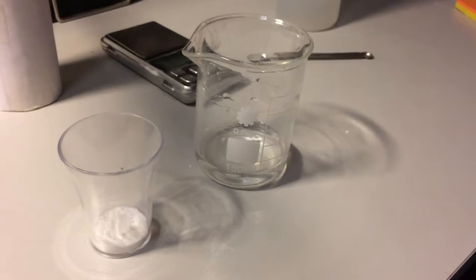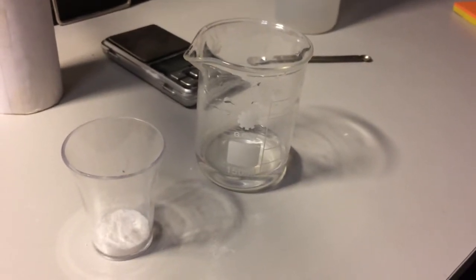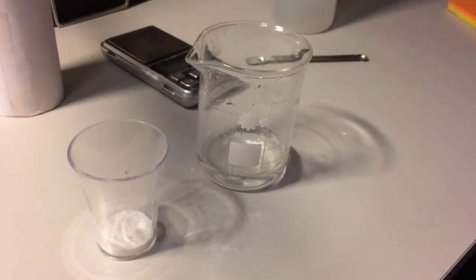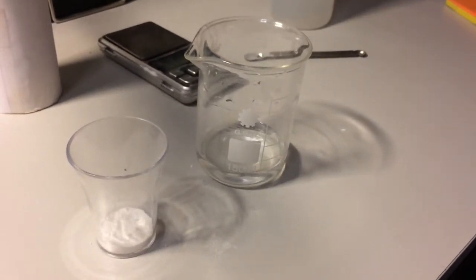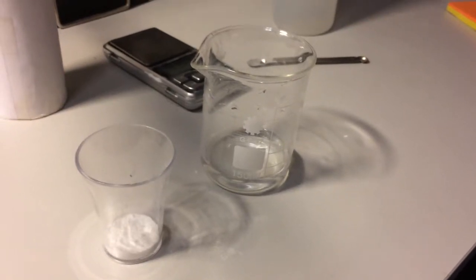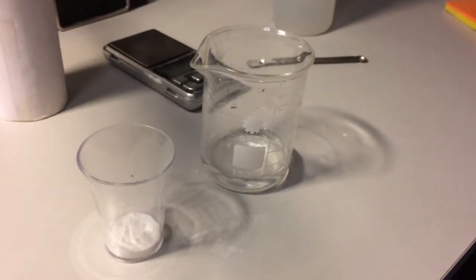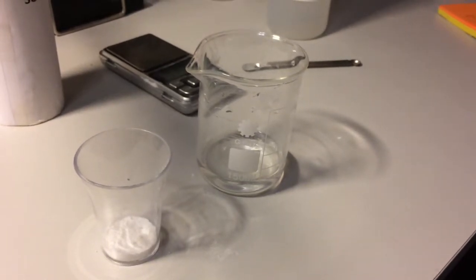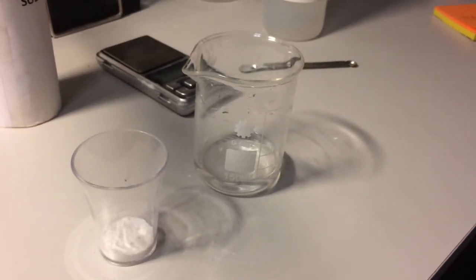Now that we've got the amounts of both substances we can now mix them together to see the reaction and the weight after the reaction. Theoretically it should be 97.84 grams because that is the total weight of the beaker and liquid.